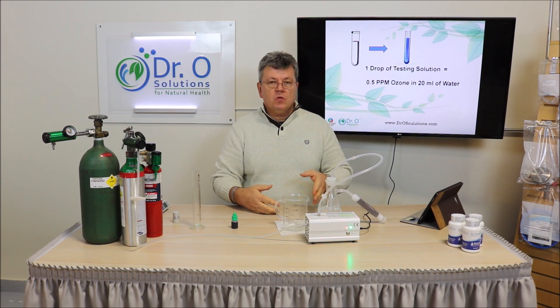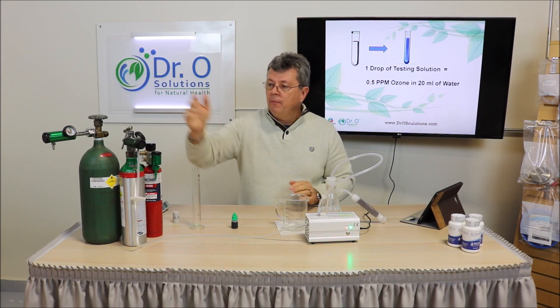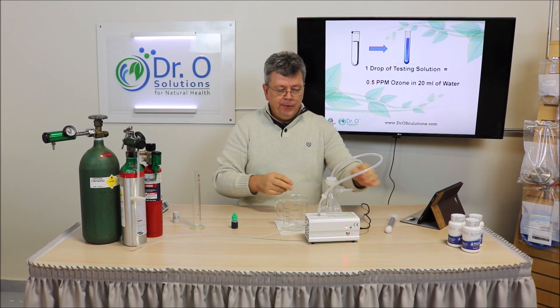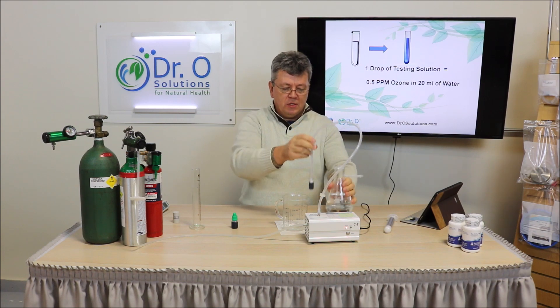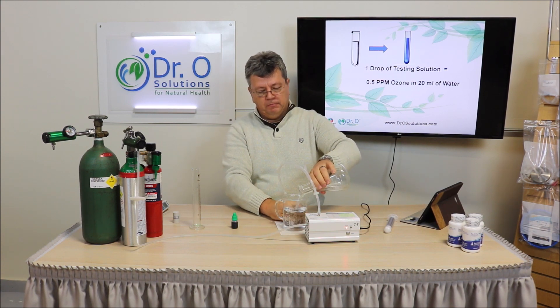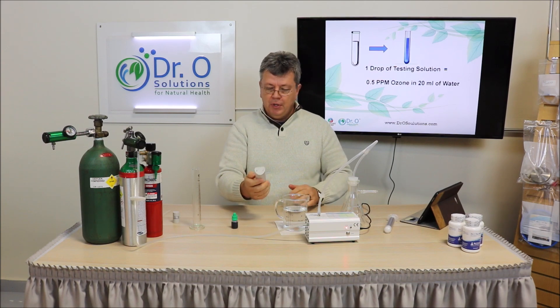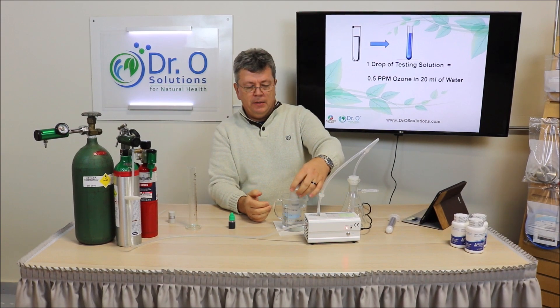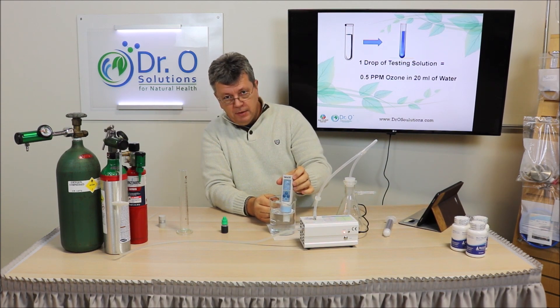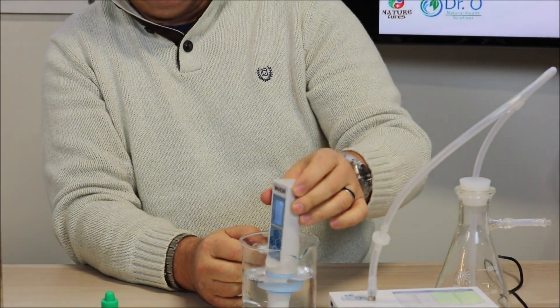So in order to know how much ozone is in the water, we developed this colorimetric testing solution. We have been ozonating this water for a while to reach a high level of ozone concentration, and right now we will test it. Let's shut this down, disconnect the destructor, and pour the ozonated water from the flask to another container. I will start my meter and put it on — and as you can see, we have two ppm, two gamma, two milligrams per liter of dissolved ozone.